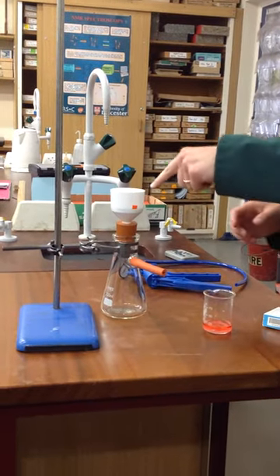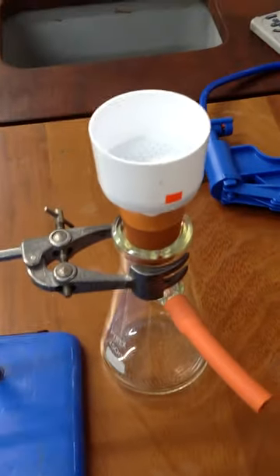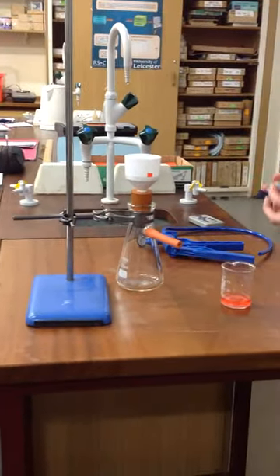And if you come over and see, you can see that there's a few holes in there that's just going to allow all the liquid to pass through. Now we don't just want those because they're pretty big, so we've got a filter paper on top.